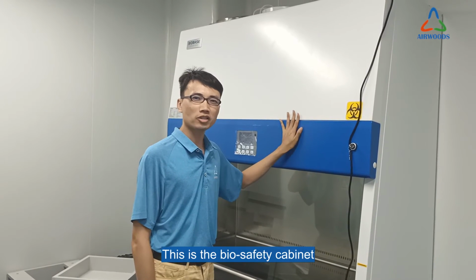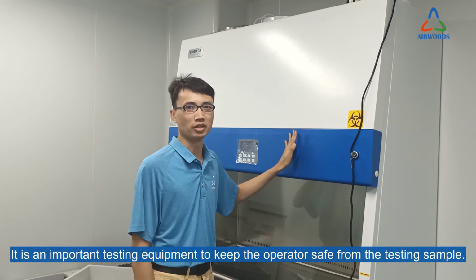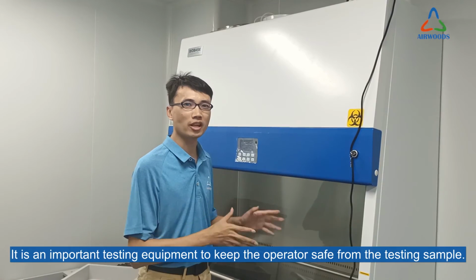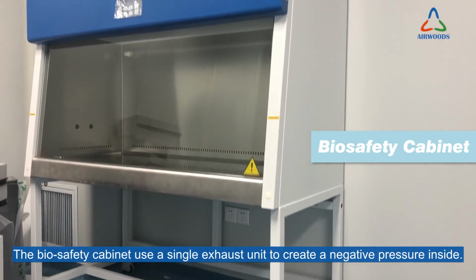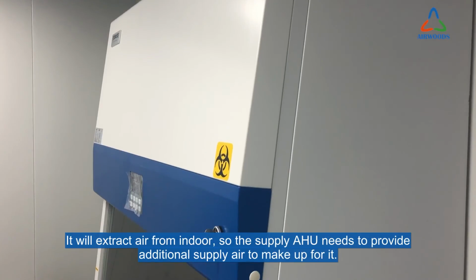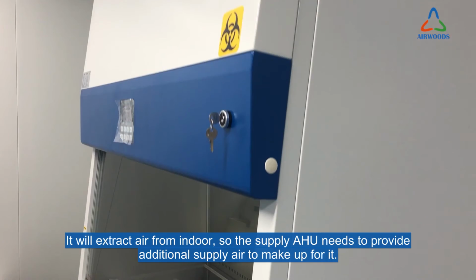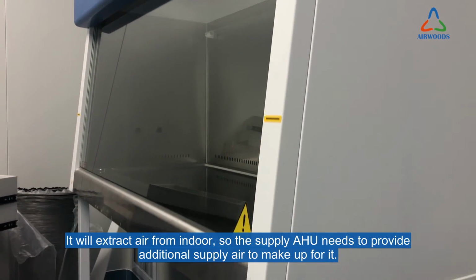And this is the biosafety cabinet. It is an important testing equipment to keep the operator safe from the testing sample. The biosafety cabinet uses a single exhaust unit to create negative pressure inside. It will extract air from indoors, so the supply AHU needs to provide additional supply air to make up for it.